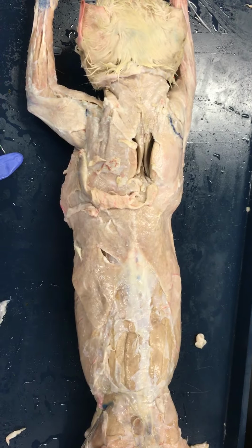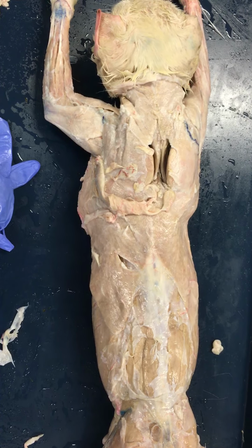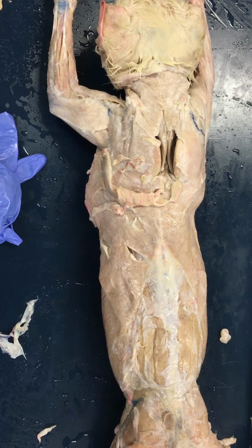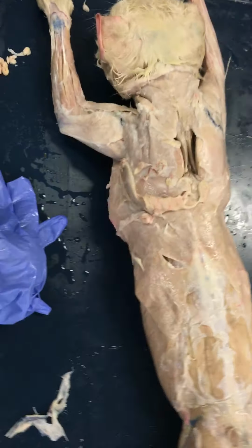It probably serves that purpose more in an animal, from how you're talking about extending the arm. Yeah, because all it's doing for us is that backswing that you were not too impressed with. Special swimmer, maybe. Maybe, yeah.